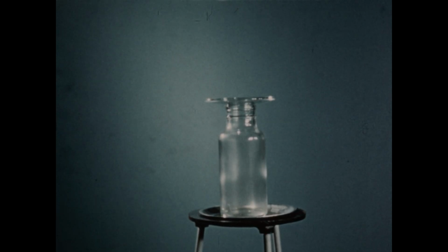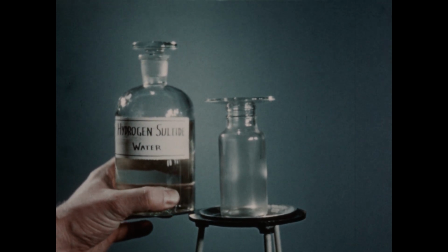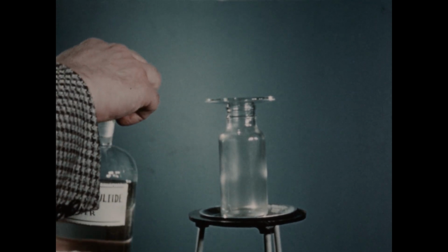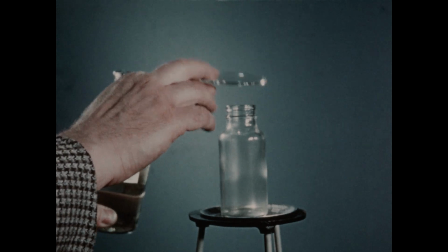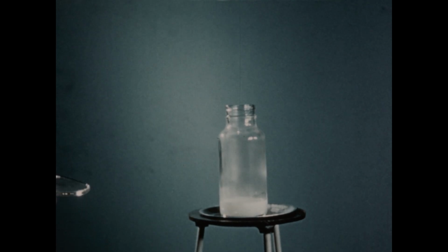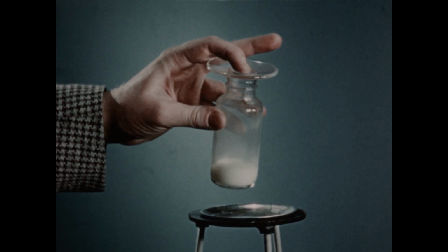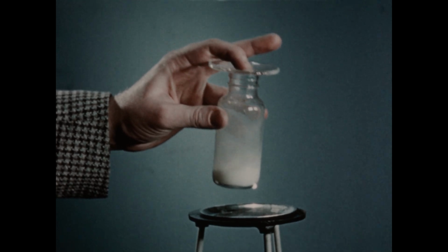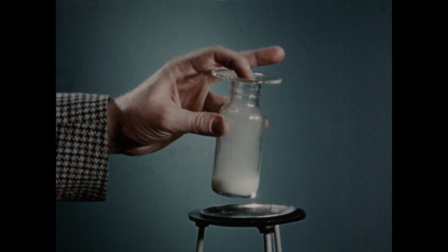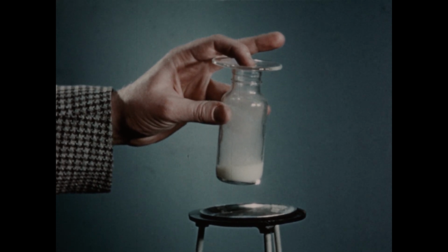Thirdly, we'll discuss the reaction of chlorine with another compound, hydrogen sulfide. In this bottle, we have a solution of hydrogen sulfide in water. I'll place a few milliliters of this solution in a small bottle of chlorine, and then agitate. You'll notice the formation of a dense milky material in the solution. This is free elementary sulfur, which has been formed by the oxidation of the hydrogen sulfide by the chlorine in the bottle.